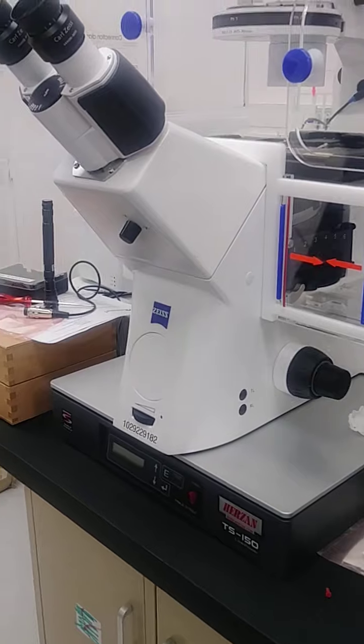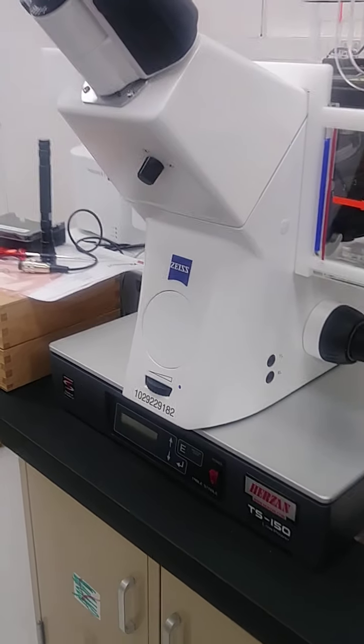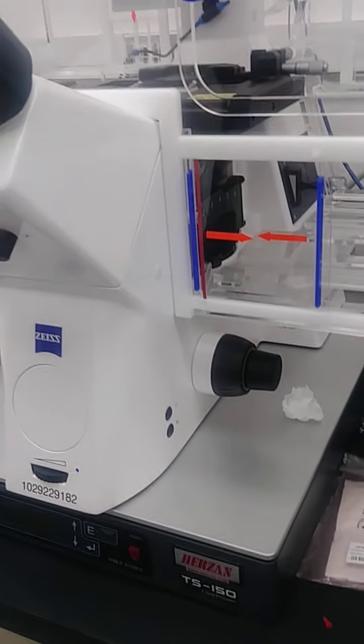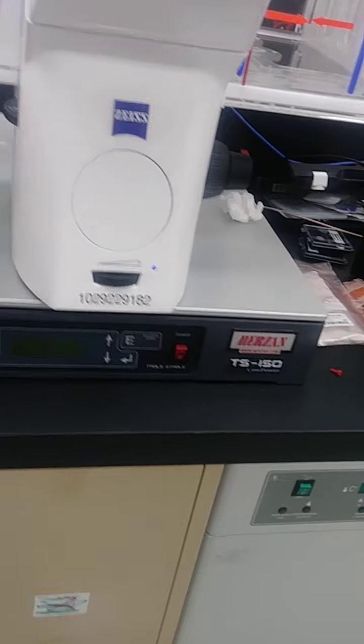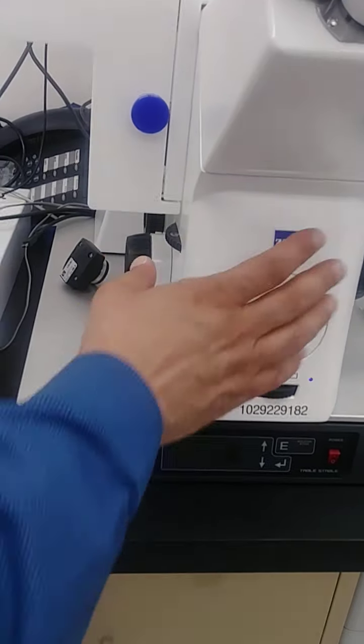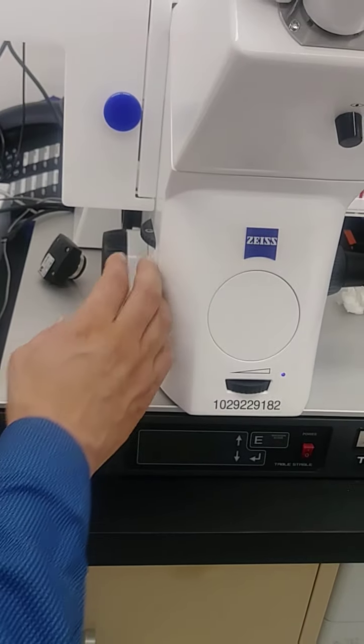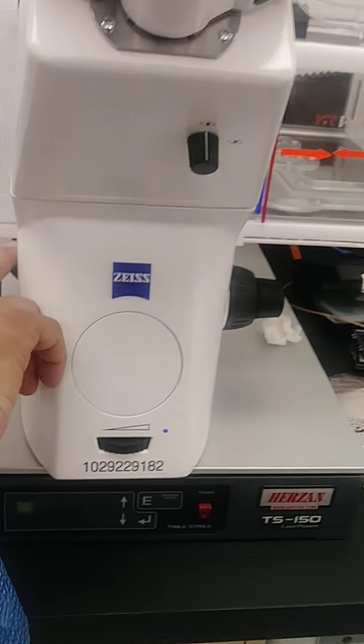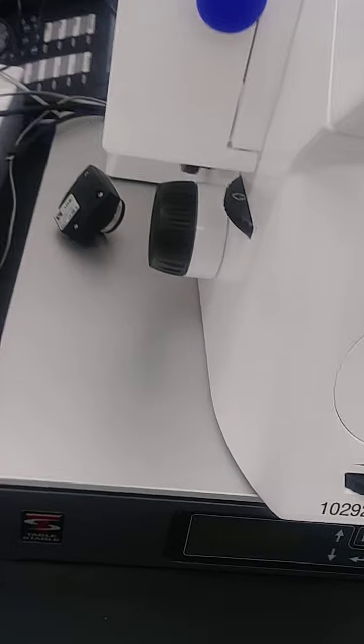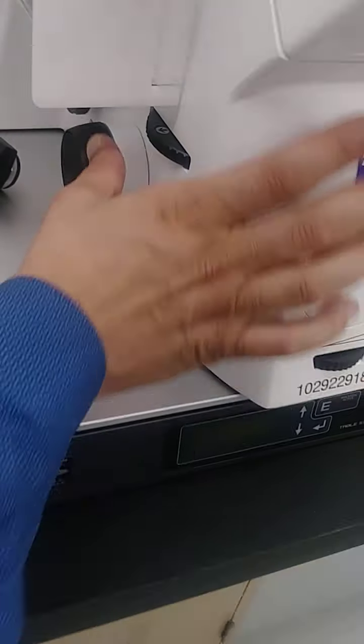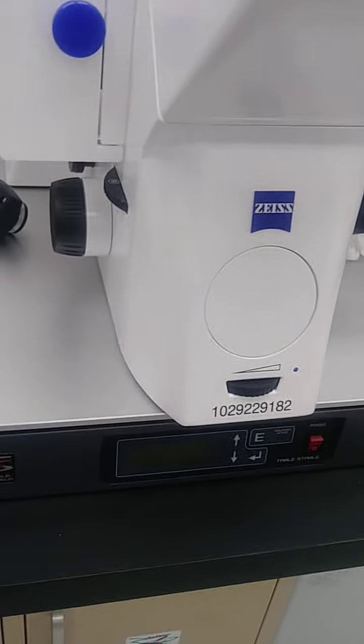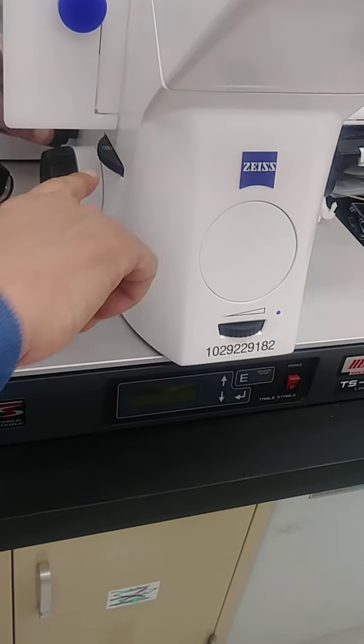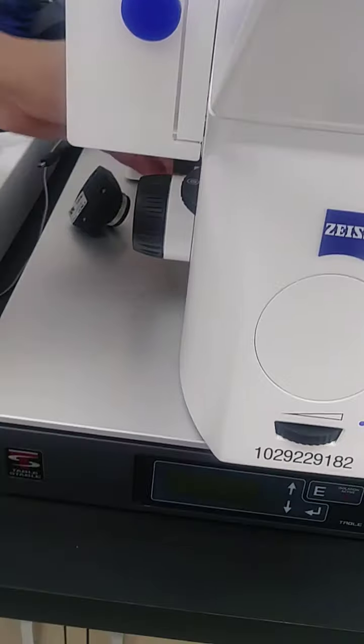Now there's only two other things really to concern yourself with off the bat. This little knob, you saw it before. If we open it up, that knob is pointing the light out that tube. So if you ever don't see the light in the eyepiece, it has to be on the circle. So sometimes people might hit that by accident.